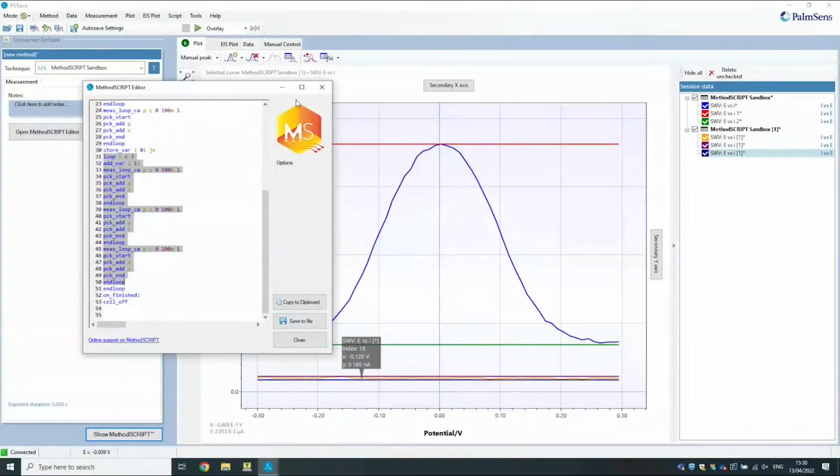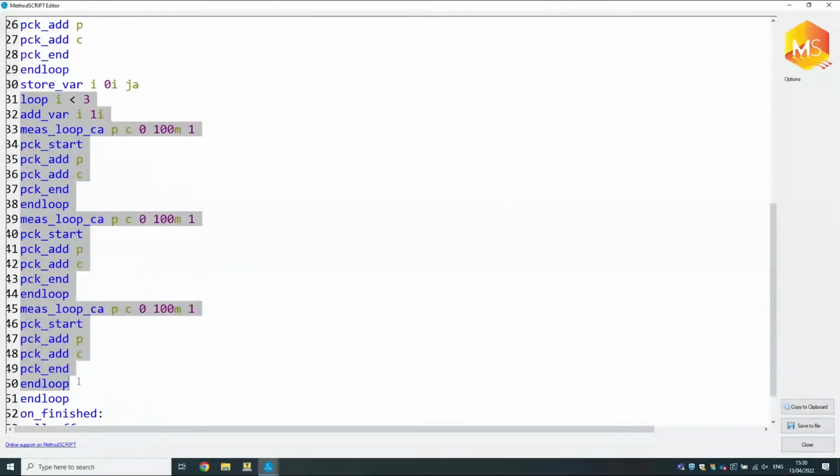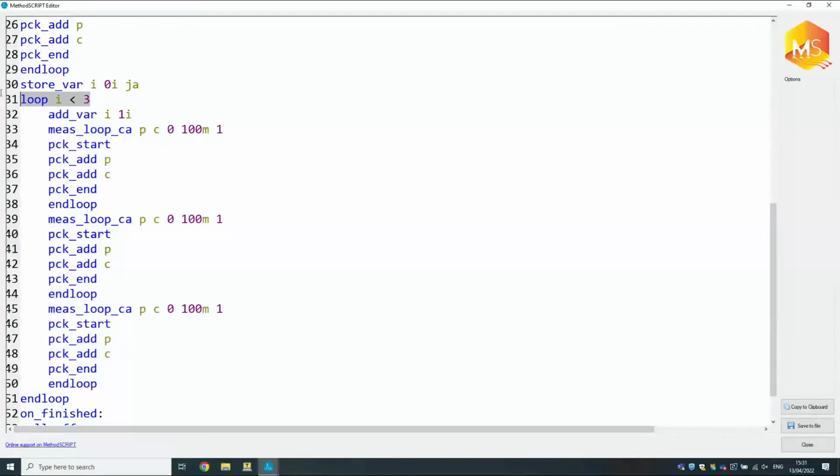But here you can see, let me zoom in a little bit. So when you write it yourself, you could skip the first one and start immediately with your repeat loop. Yes, if that's the intended behavior, then that's exactly what you could do. But there's a loop function here, so you can make any kind of loop you like, really. Yeah, that's great. And now the difficult question, can you do a loop in a loop?